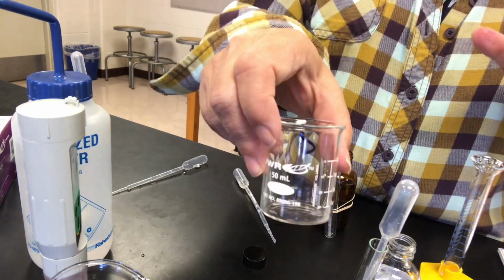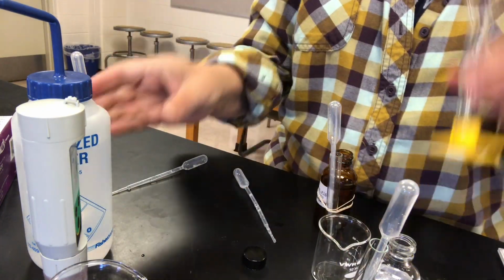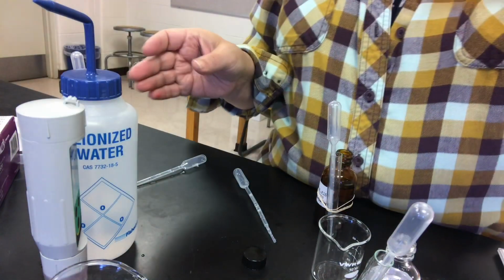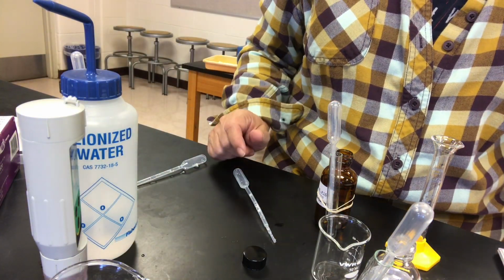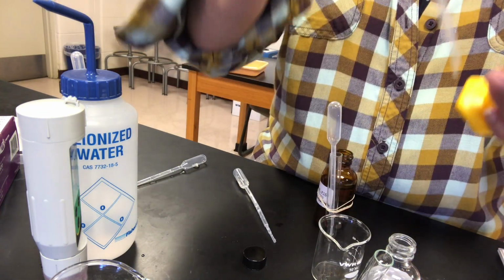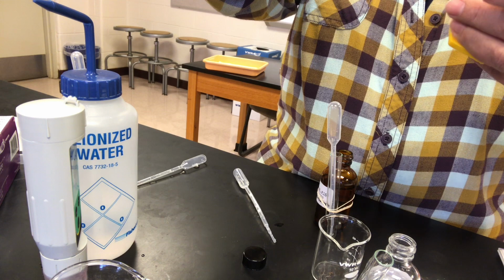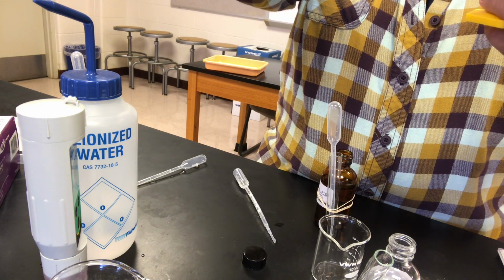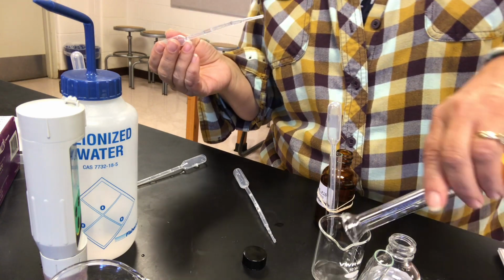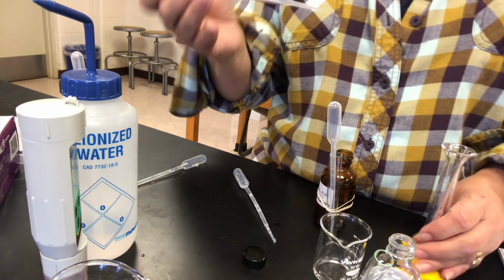And then finally, beaker D. We will stick with the same buffer, but we're going to differ the ratio. This time we're going to have 1 milliliter of the carbonic acid. So in both cases, we're going to have a 10-to-1 base over acid ratio. So there goes 1 milliliter of the carbonic acid.